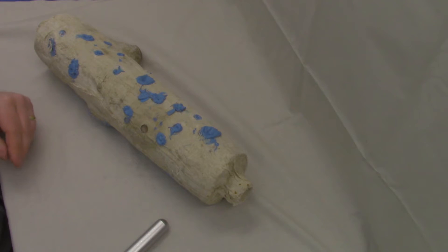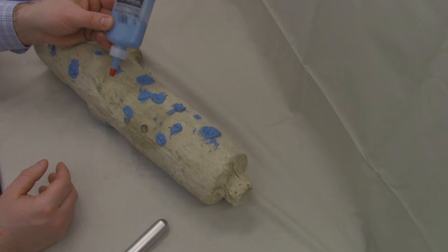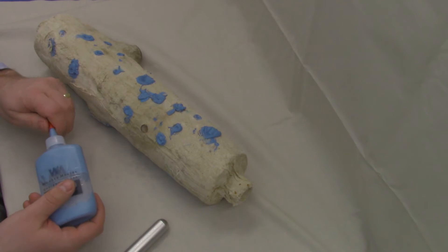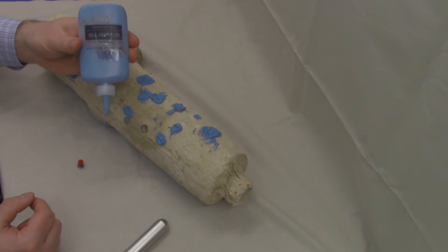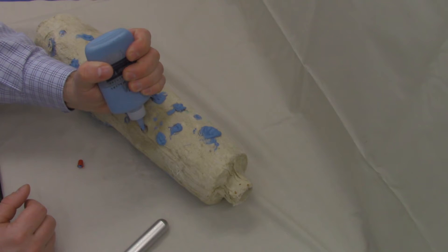Now that we've collected our sample, we want to backfill that hole with the Wonderfil. I've got an open bottle here so that I'm not opening a new bottle from the sample collection kit. We're simply going to remove the cap and you want to make sure that the Wonderfil is down at the bottom of the bottle because otherwise you'll use your bottle as a little bellows to blow material out from that opening.